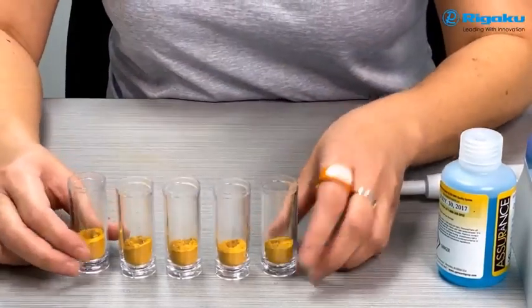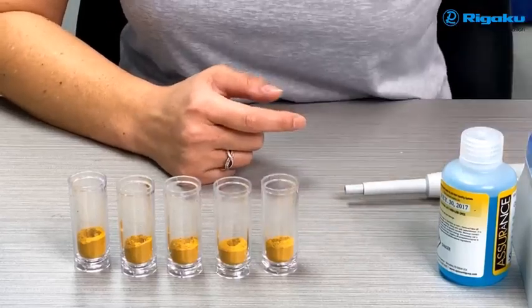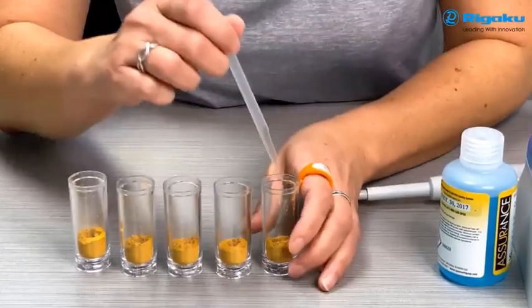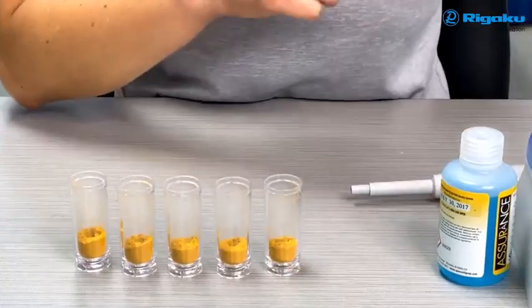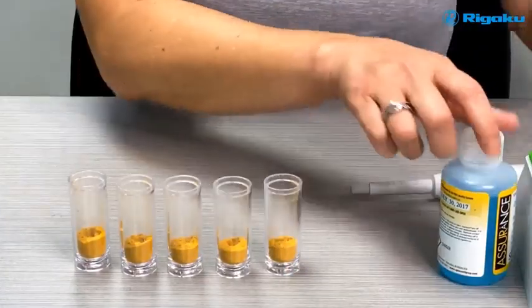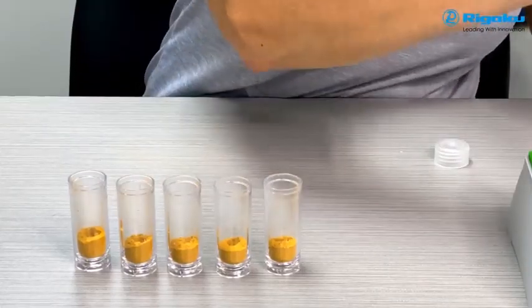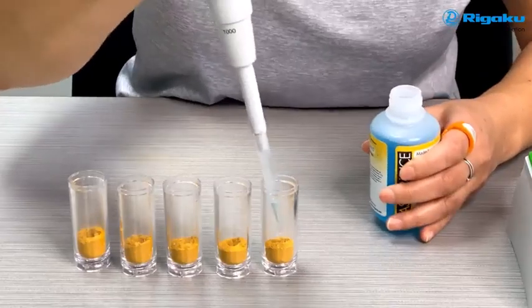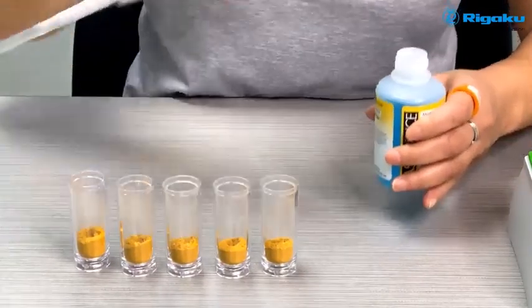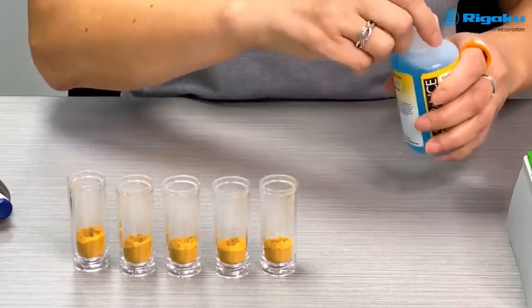Okay, now that you see we've weighed all your base material into the mixing vials, the next step is to add in your standards. But what I would like to do first is to make a little well or divot inside the material so that you can spike directly into that. Oh, so that'll keep all that solution away from the walls of the container. Exactly. So you'll not lose any material. Now, when you spike those in, you're going to be spiking in all different concentrations in each of those for each of the metals.